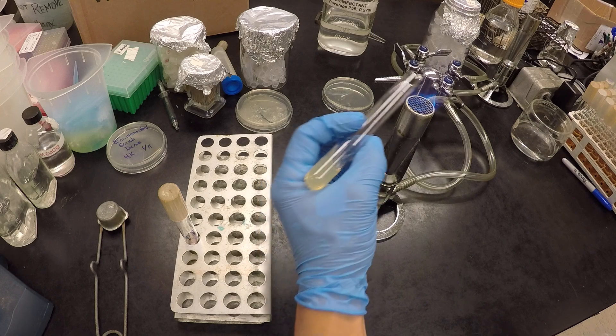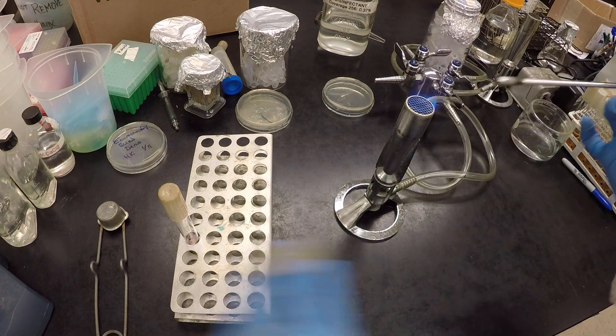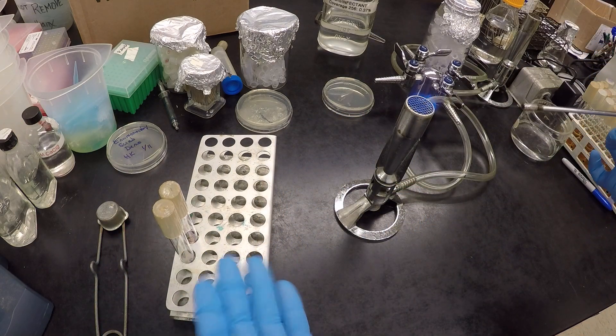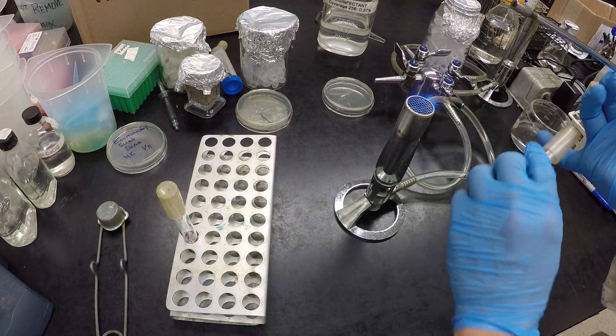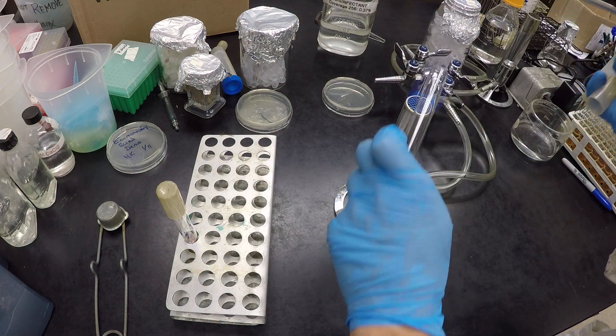Then we pull out, flame, close. Now I'm going to grab my sterile slant, twist and pull, flame.